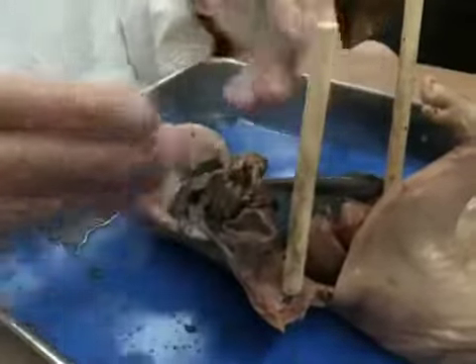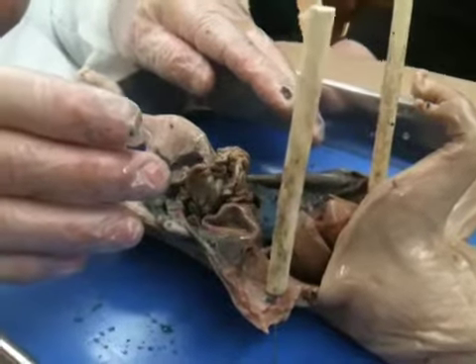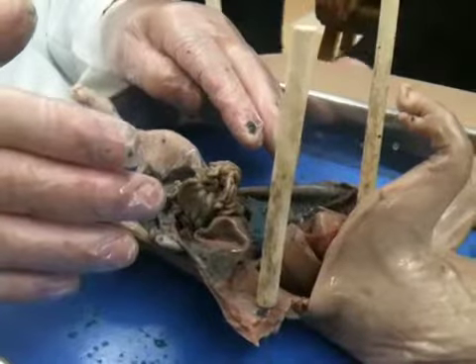All right? Notice how long that must be if it were to be stretched out. Let's do it. We should do that. Not even trying to be funny. We should do that. Yeah, shouldn't we?